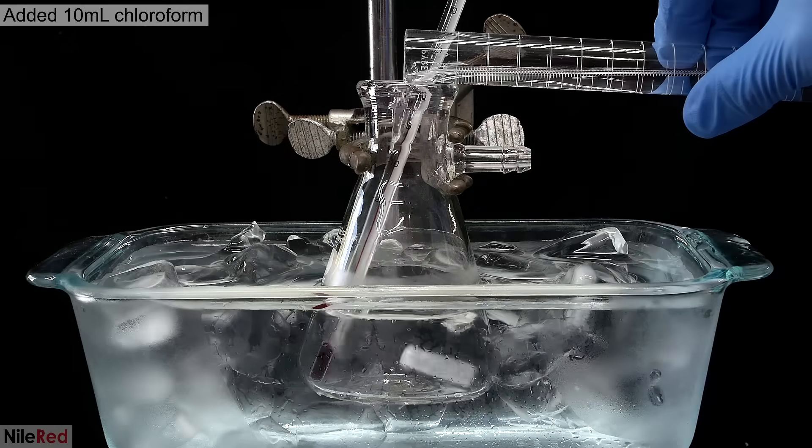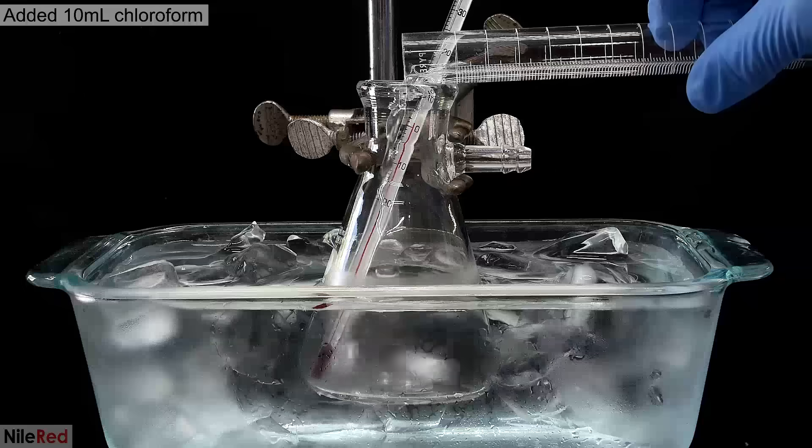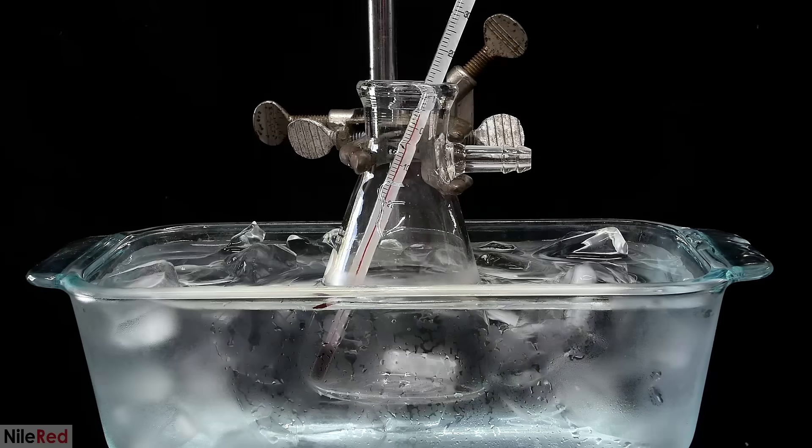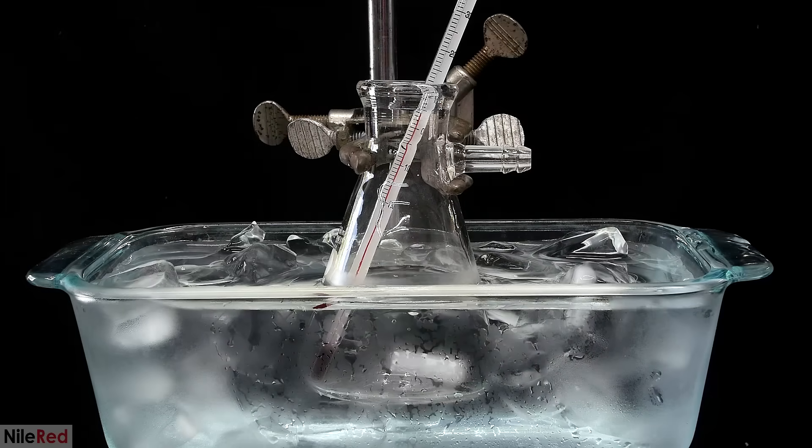Once it had cooled, I went ahead and added 10 milliliters of chloroform. When the chloroform is added, it warms up to about 5°C, so again I wait for it to cool down.